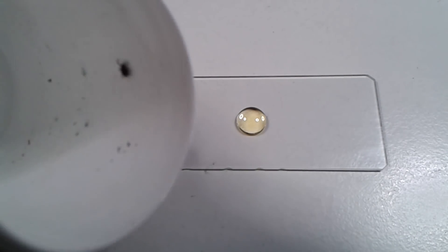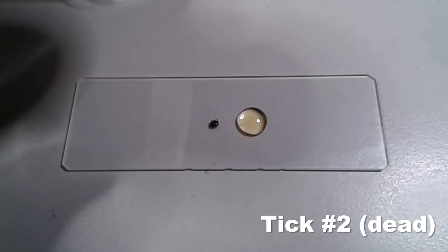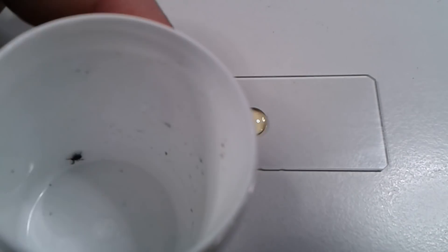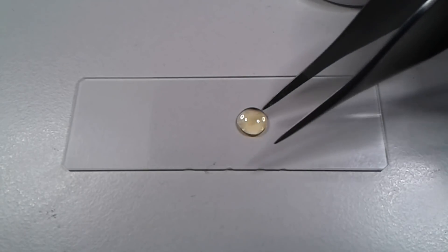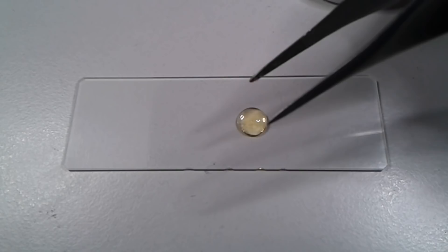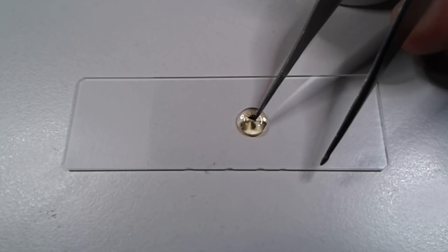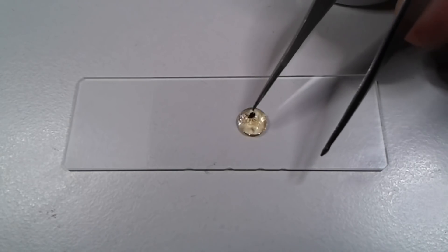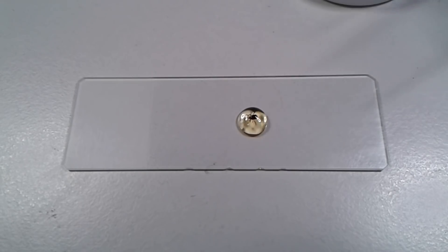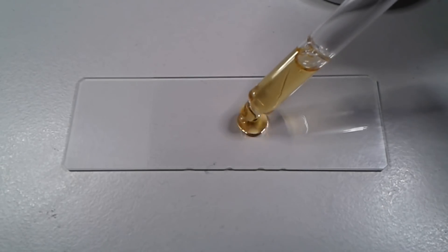It was not so easy because the tick was clinging to the plastic container. I tried to invert the container to get it out, and out came the dead tick from the day before, while the other one was still inside. So I dipped the tweezers into the mounting medium to make them sticky, touched the back of the tick, and it stuck to the tweezers. I could then place it directly into the mounting medium. I also put another drop of mounting medium on top of the tick, which is important so it's completely surrounded — otherwise we get too many air bubbles.